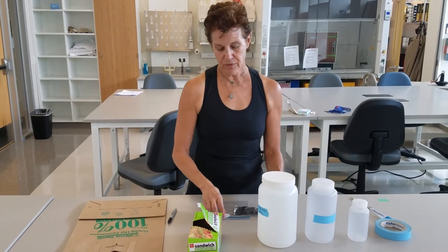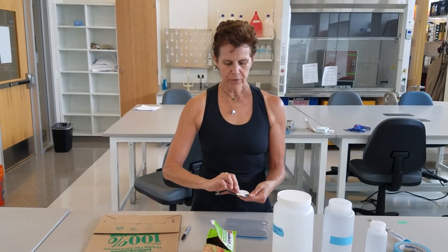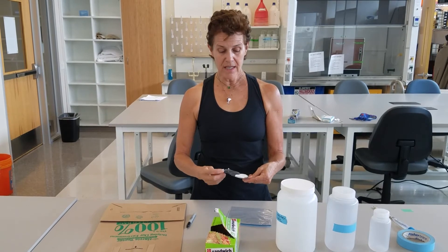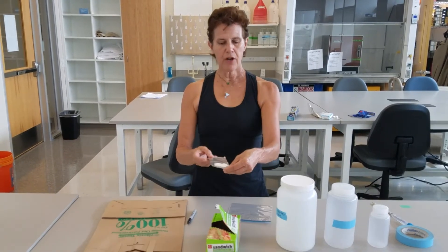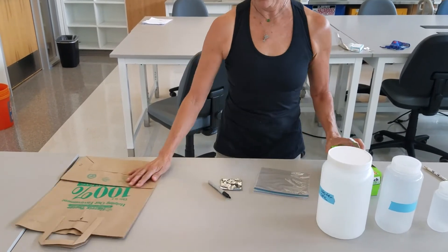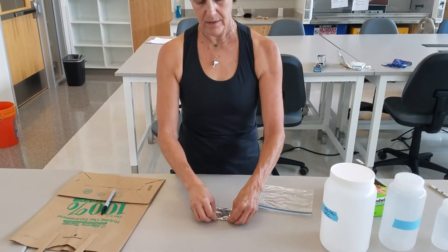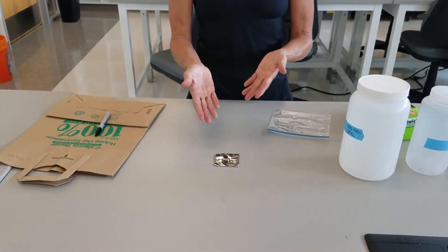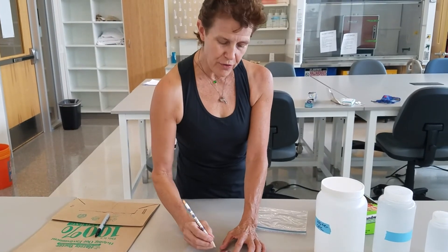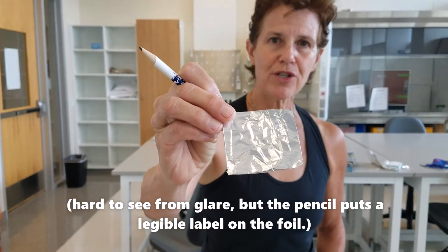One of the other things we do is filter water samples at the site. To filter, we use a microfiber filter, which is going to capture sediment, algae, and all sorts of other things. What we do is pre-weigh the filter in a foil burrito — I put the filter in foil, fold it over, weigh it, get an accurate weight, and record it. For labeling these I use a pencil, because I don't want to perforate the foil or the filter. I usually go simple and just number them: one, two, three, four, five.